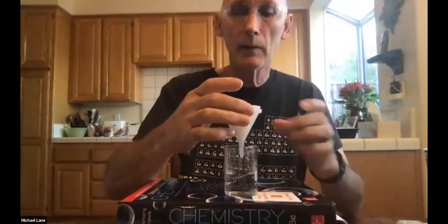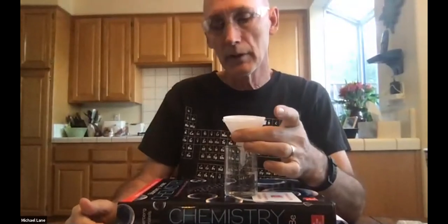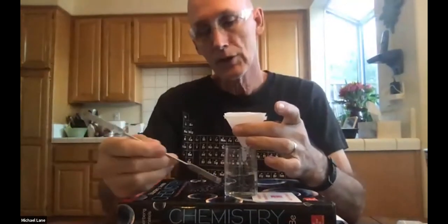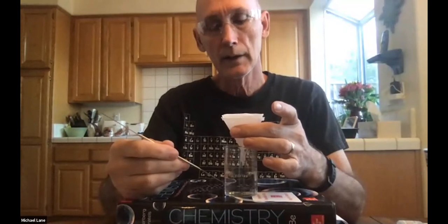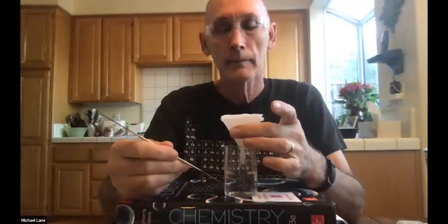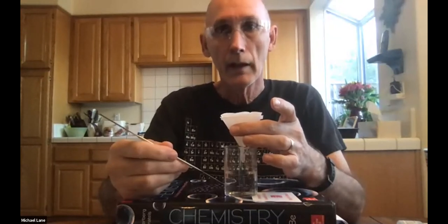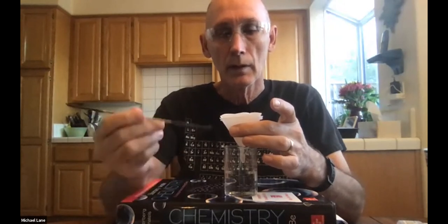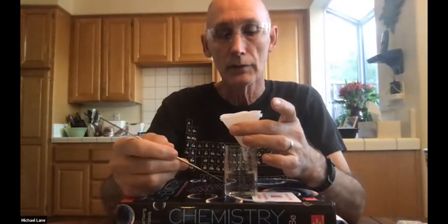Still a few drips. Now, again, what you can't see is I'm almost done. There's perhaps only a couple more milliliters left. Now, while we're doing this, I'll ask the question, what's in here? What ions are in here? Well, we started with calcium chloride and sodium carbonate. The calcium carbonate's in here, so that means the spectator ions should be down here in this solution, sodium chloride.